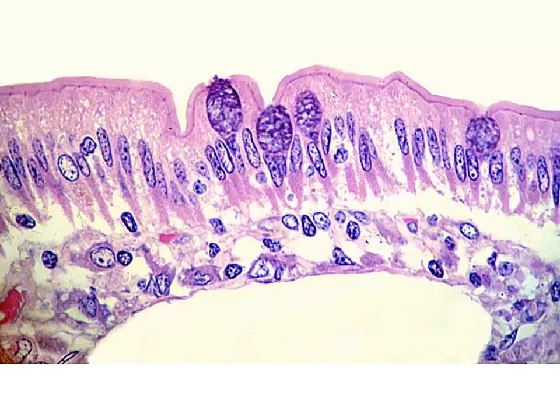Closer magnification, again, we see our striated or brush border across the surface. Here are our goblet cells, and then our surface absorptive cells as we dive down into a villus. This could potentially be a central lacteal. It's difficult to see in this particular plane of section.